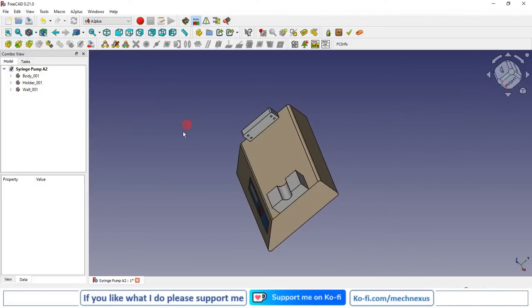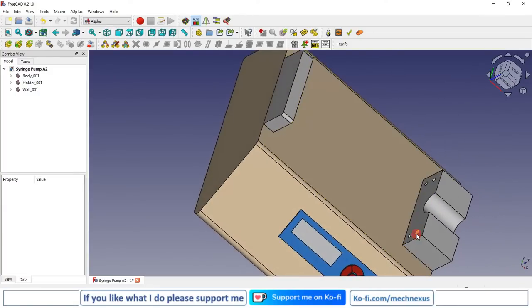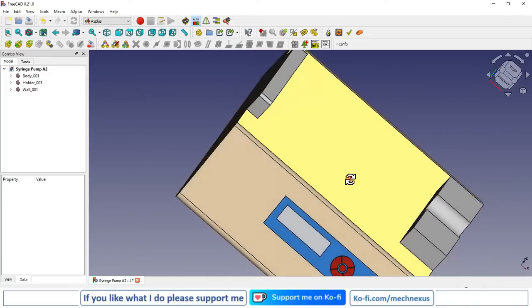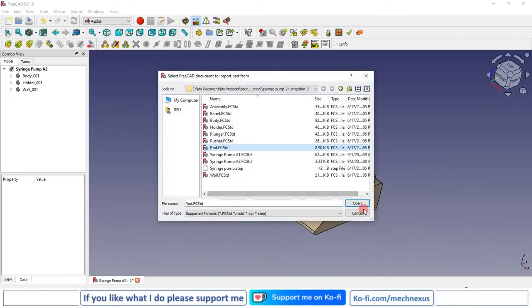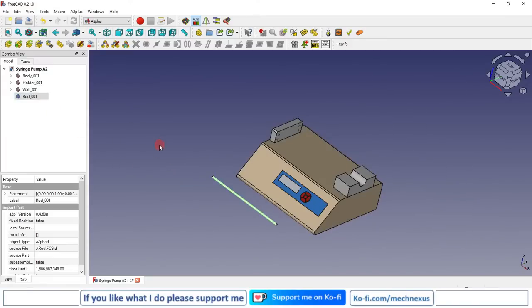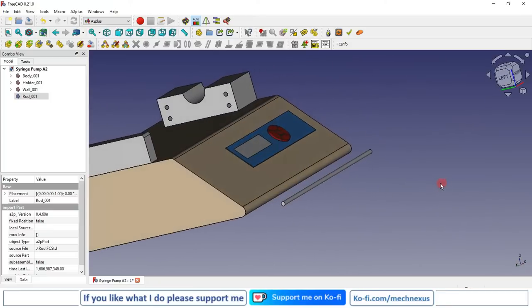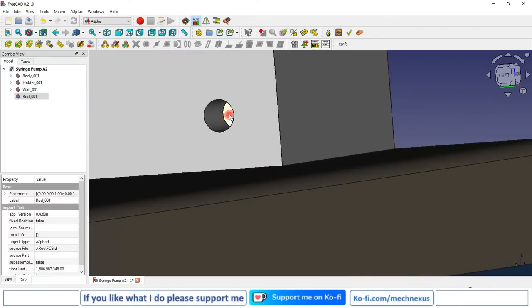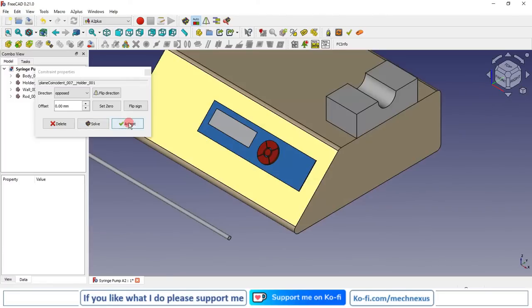Now our fourth part will be the rod, which will be passed through the hole from this hole to this hole. So we will assemble 4 part 1 2 3 4, which will connect this body and this body. So I will go to the add part and select on rod and insert it. Now I will select this face and inside face, and I click on coincidence constraint, and I will accept it.